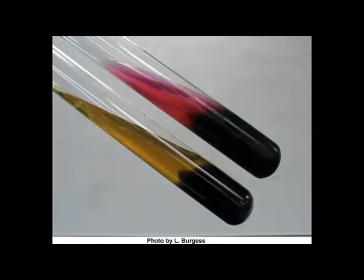It is important to note that hydrogen sulfide production will only occur in acidic conditions. This means that fermentation of some form must have occurred in order for hydrogen sulfide to be produced. Both of the organisms shown here are hydrogen sulfide producers, or H2S positive. The organism on the top is a glucose-only fermenter. The yellow from fermentation, shown by phenol red, is disguised by the black precipitate from sulfur reduction.